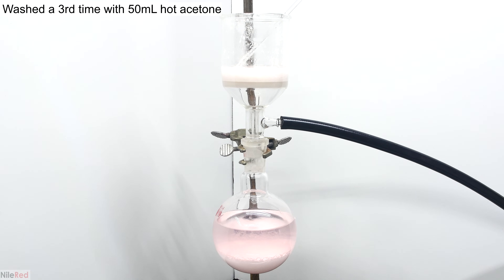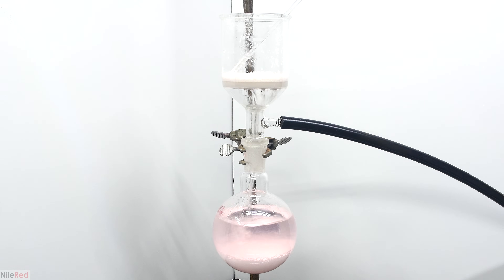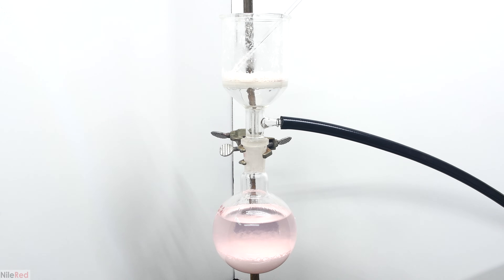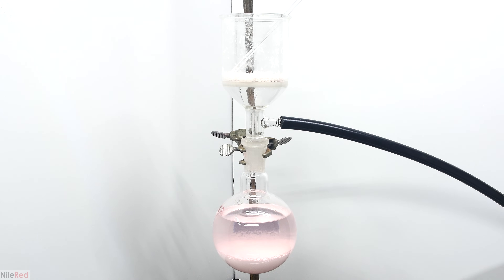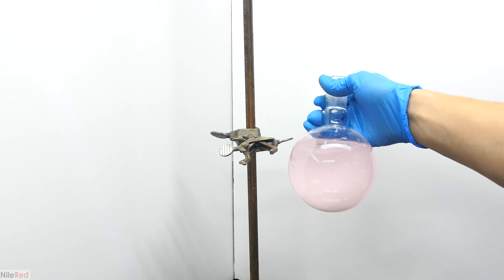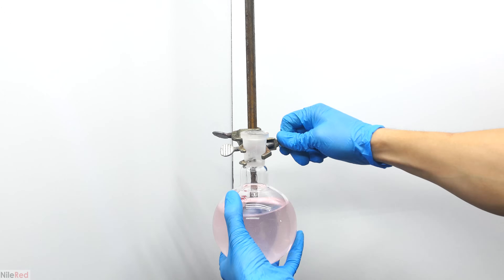The stuff that remains in the beaker and filter is mostly filler and can be thrown out. The solution is pink because unfortunately Bayer decided to brand their pills using red dye — even after purification the ASA might be a little bit pink. To avoid this it's best to use a brand that doesn't include any dyes. At the bottom of the flask it looks like there's a lot of crystallized ASA, but with just a little bit of swirling everything quickly redissolves.